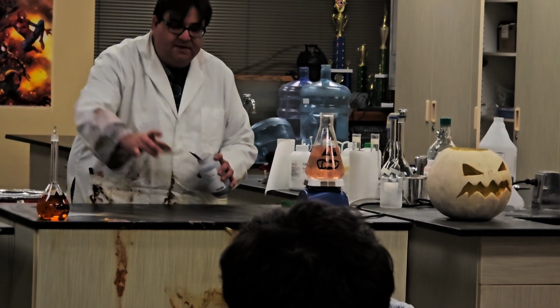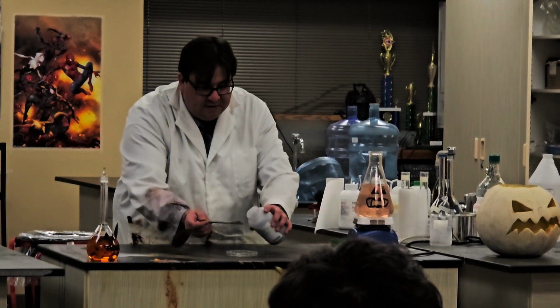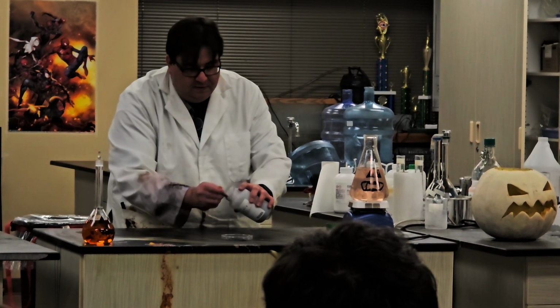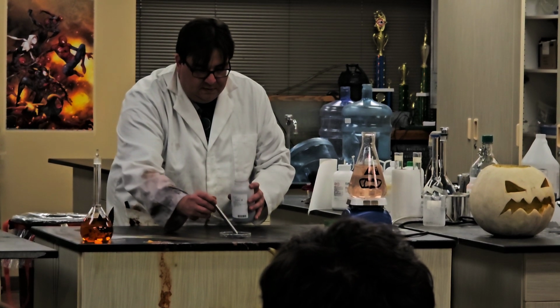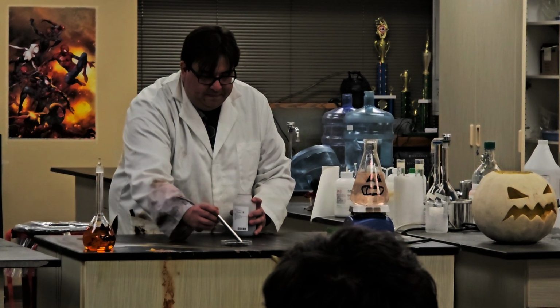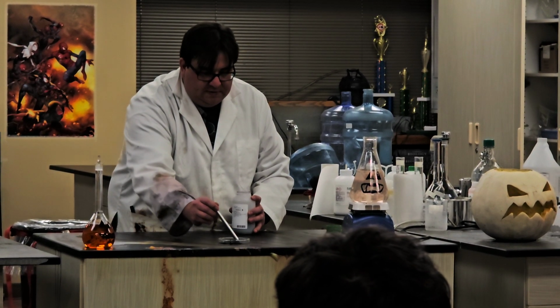So I have this kind of oily substance. I'm going to put these purple crystals on here. And it'll take a second. Watch what happens.